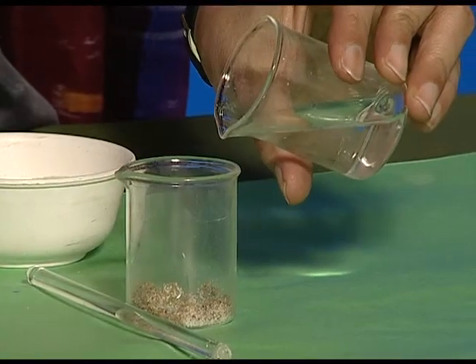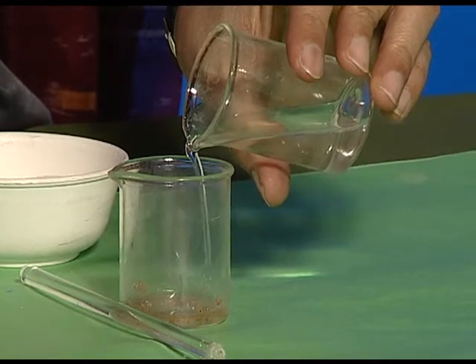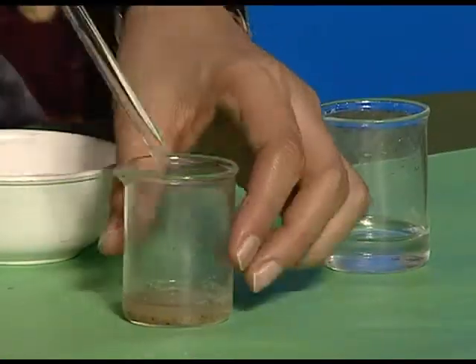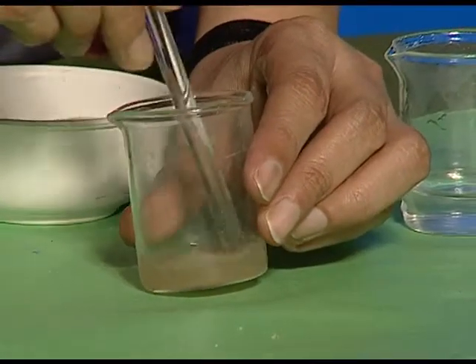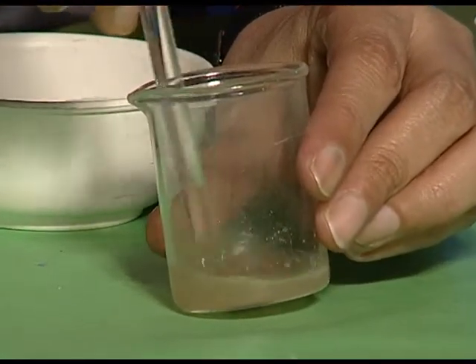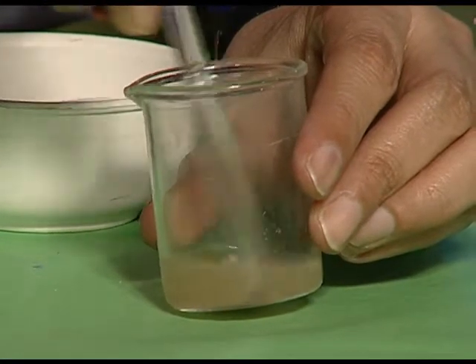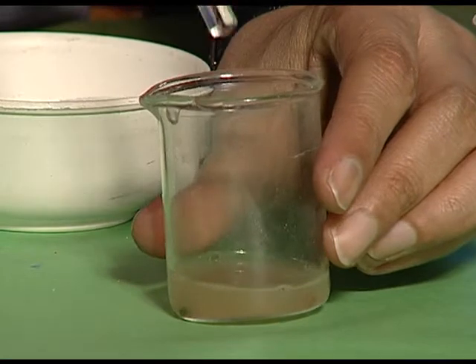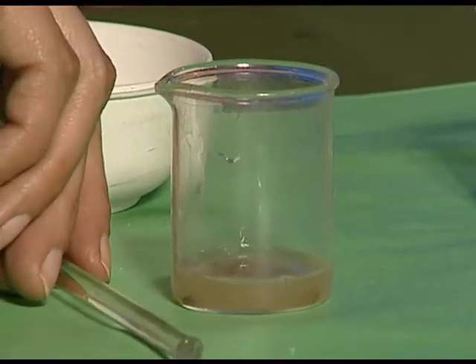We will pour water into the beaker containing sand and salt. Stir the mixture well and leave it undisturbed for some time.